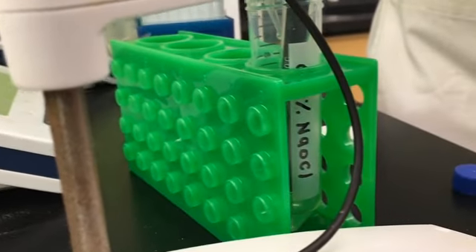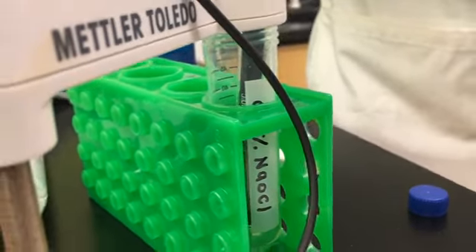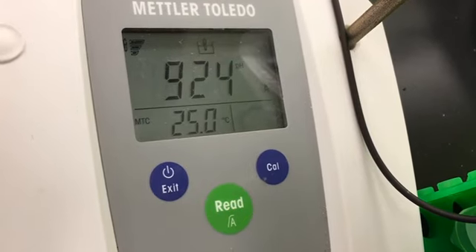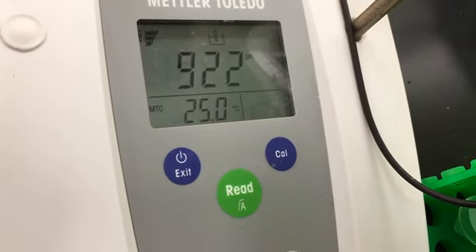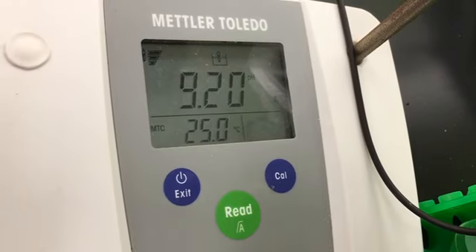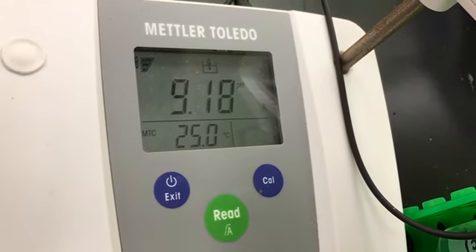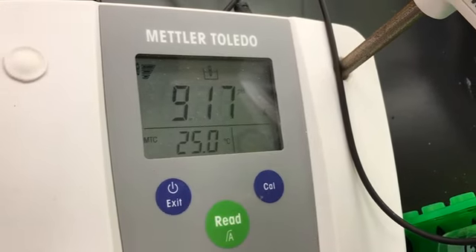Drop by drop, right? And you observe the monitor of your pH meter. So how many drops have you added so far? I added almost 8 drops right now. It depends on the total volume of the buffer that you want to prepare. So I think with 2 more drops.